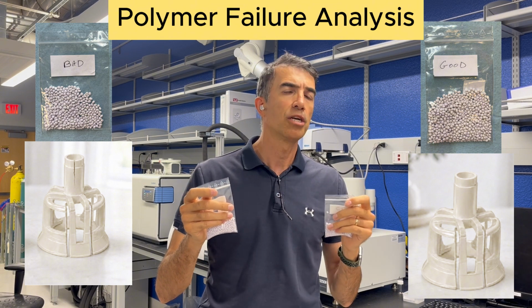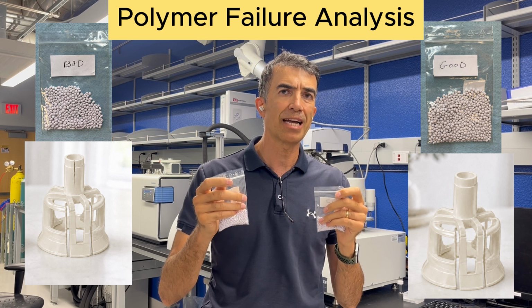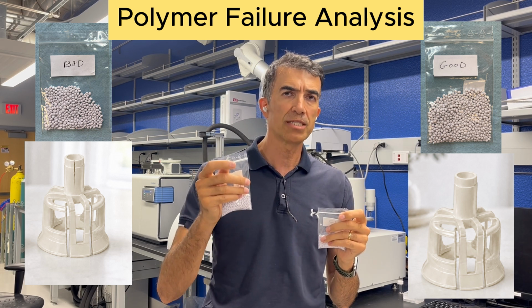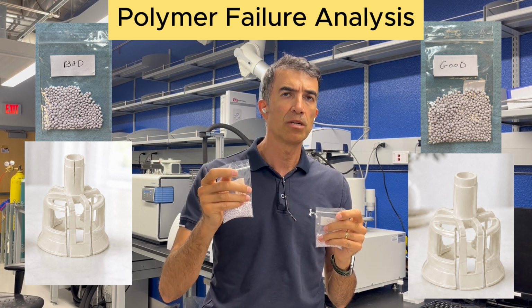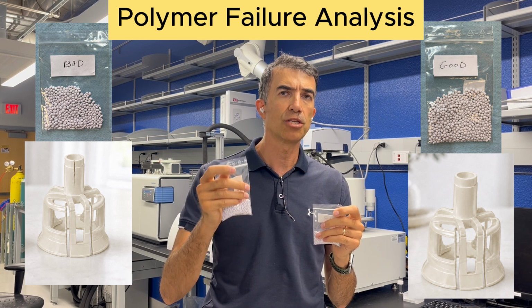We're going to use the instruments in the lab to identify what is causing that, what would cause one polymer sample to produce injection molding parts that crack during assembly.